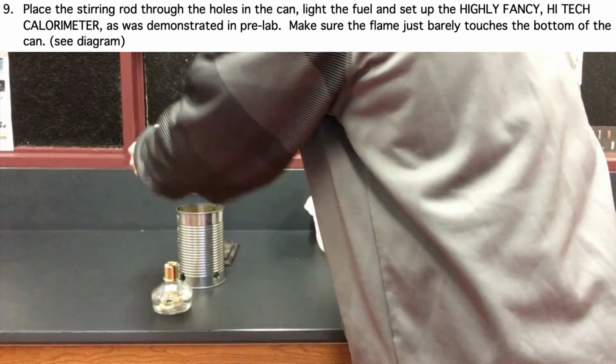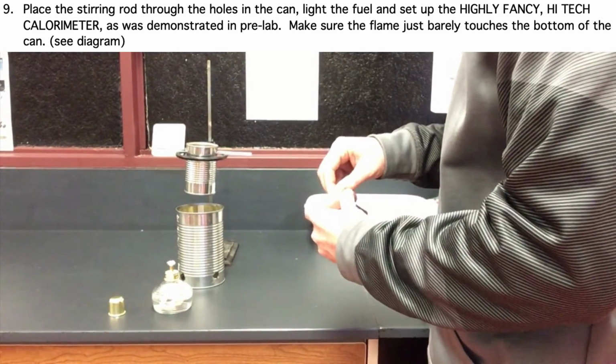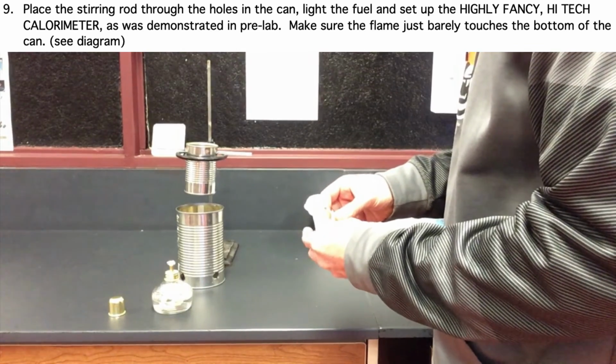Now we are going to ignite the fuel and use the ethanol to warm up the water inside of the can.